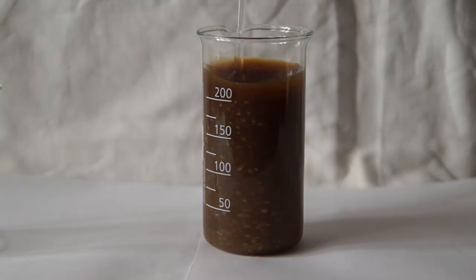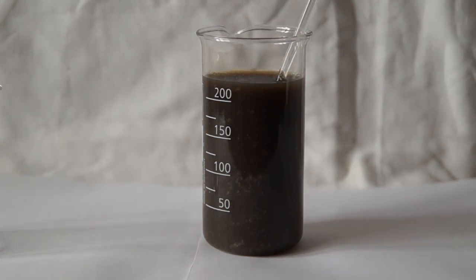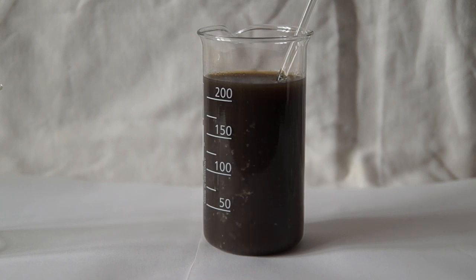And it is because of free iodine which is forming and reacting with starch. Starch is a very good indicator of iodine.